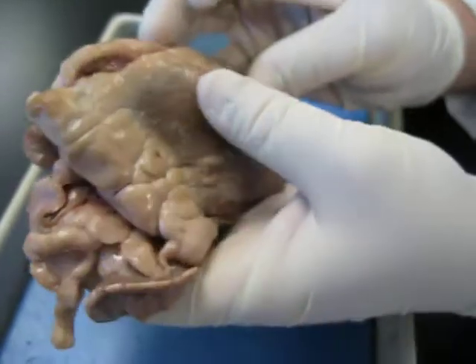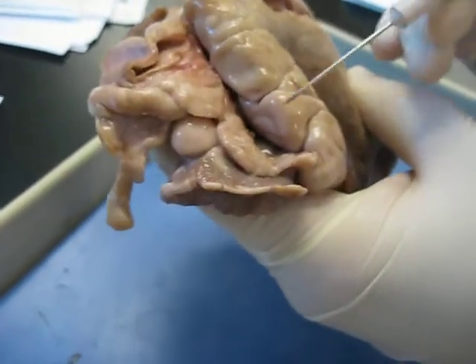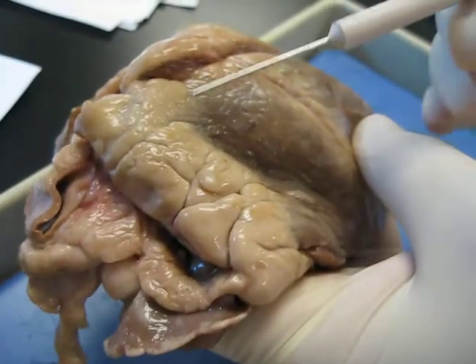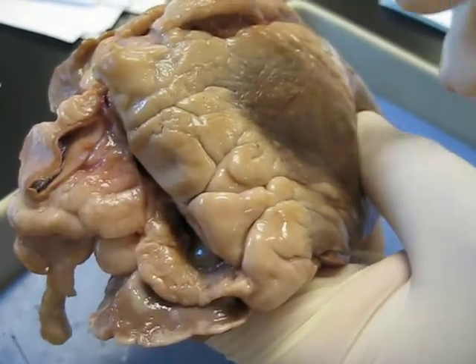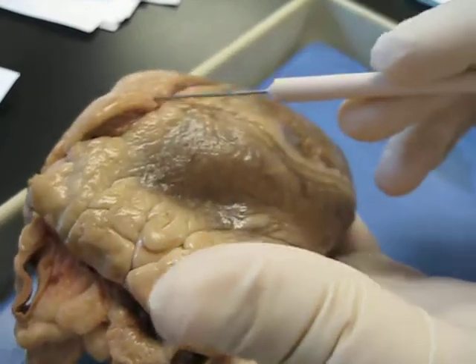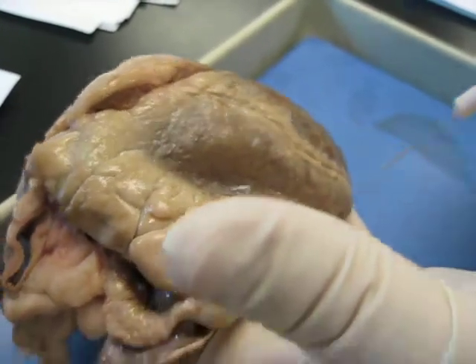Okay. All right. First of all, if you're wanting to find which side is which, this one was chopped a little short, so it's not as easy. With most of the hearts that have a little bit less chopped away, you're going to see the vessels on the anterior surface. Most of the vessels are not opening out towards you. The vessels are either going up or out towards the back. So if you see none of the vessels opening towards you, that's one clue that you're looking at the anterior. The other is the anterior interventricular sulcus, which is fat-filled and covered with a membrane here. It's a nice long diagonal one typically.